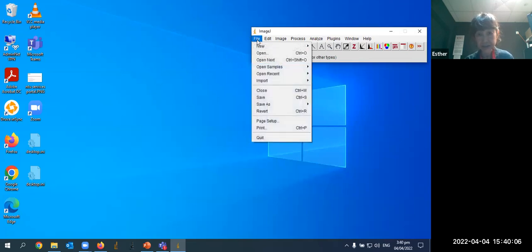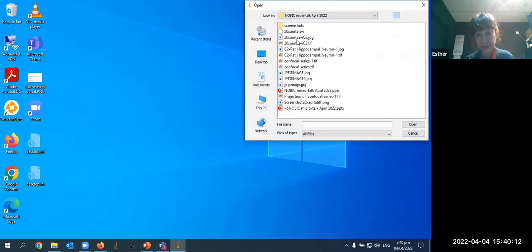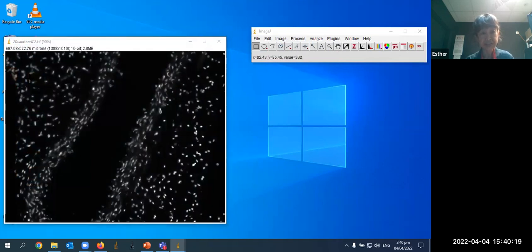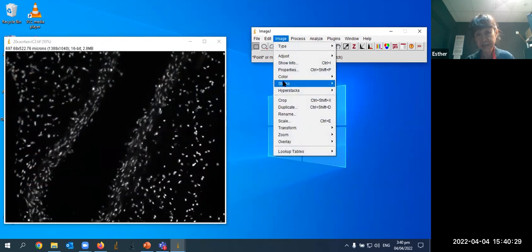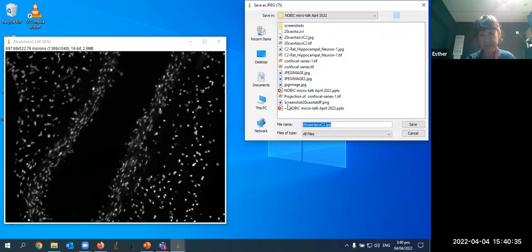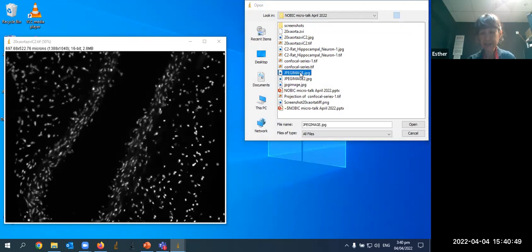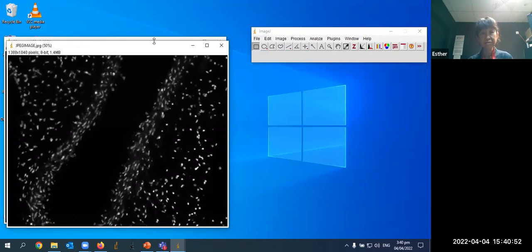So I have ImageJ open. I'm going to open a TIFF file, the same one that I showed you in my PowerPoint. And it is this one. So here you can see the units in microns. And if I save this as a JPEG, save as JPEG, and let's just say JPEG image. Okay, so I'll open that one up. Open JPEG image. Okay, so they look very similar.